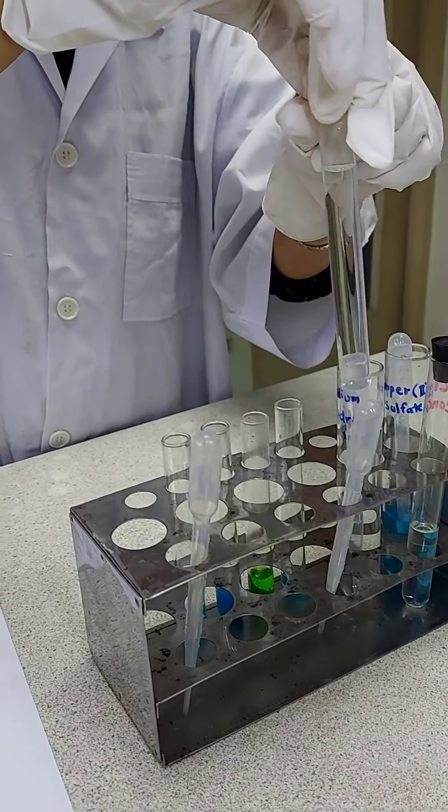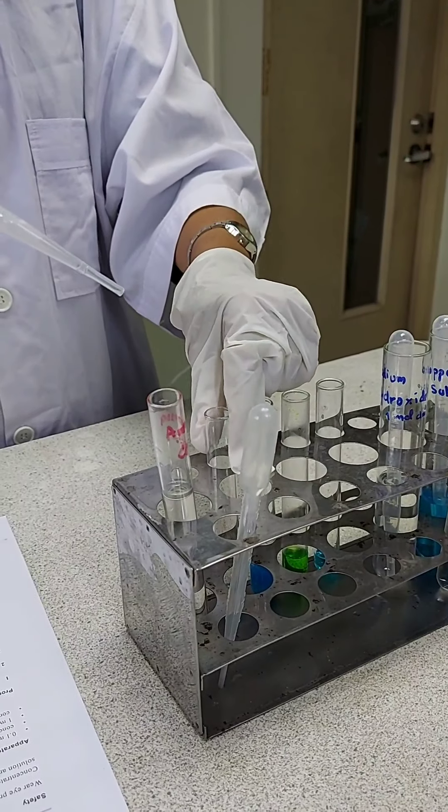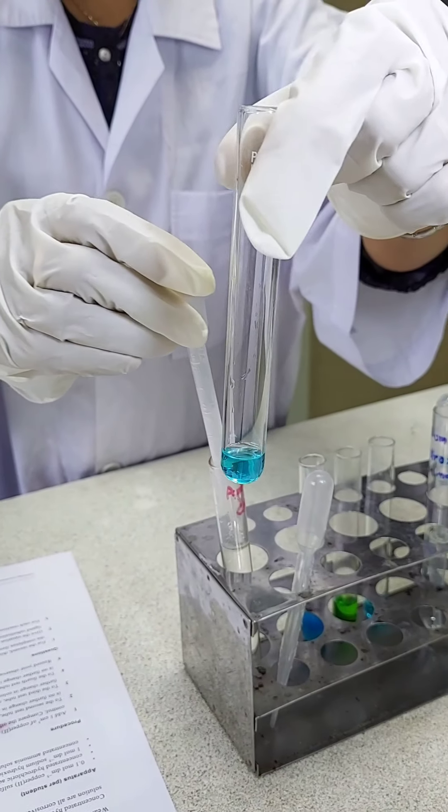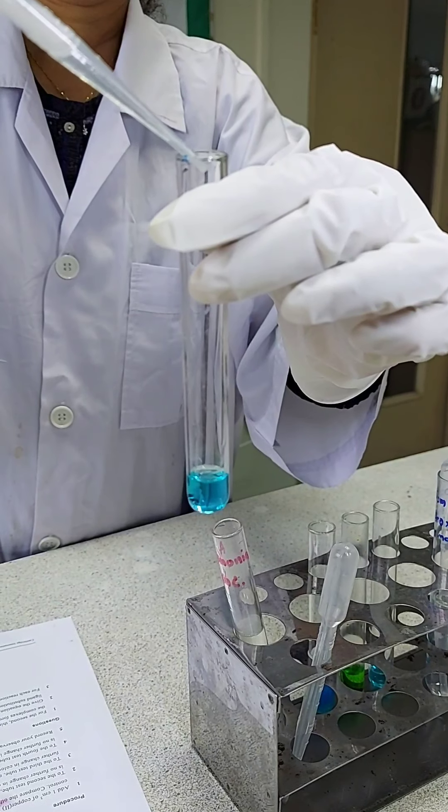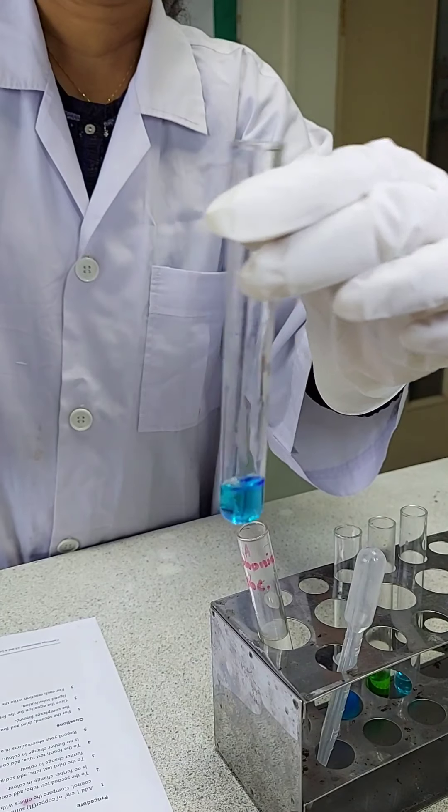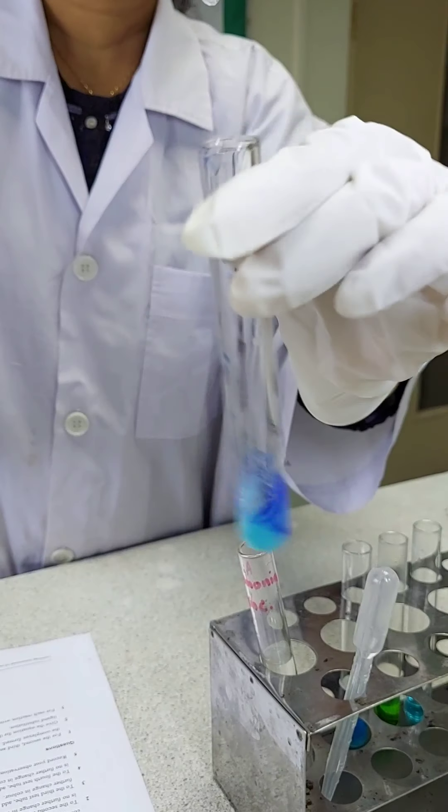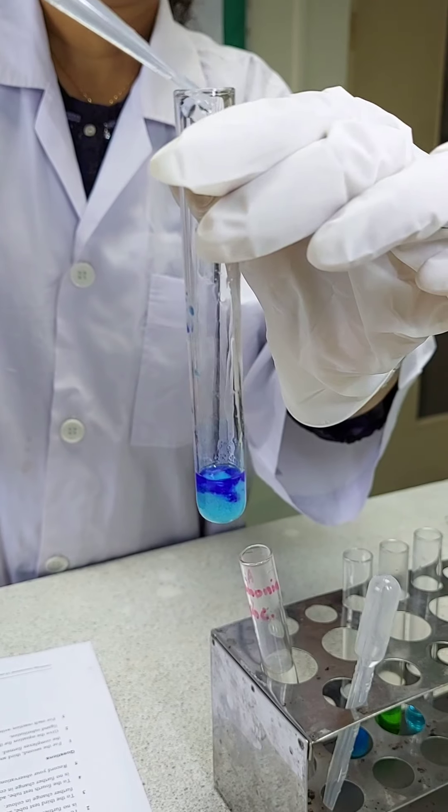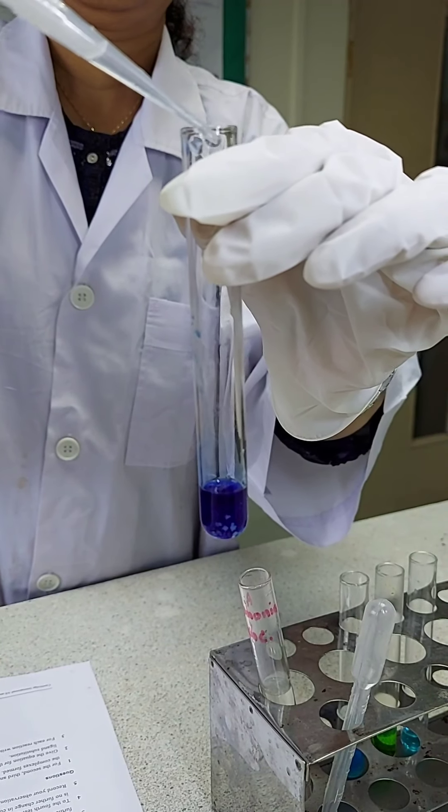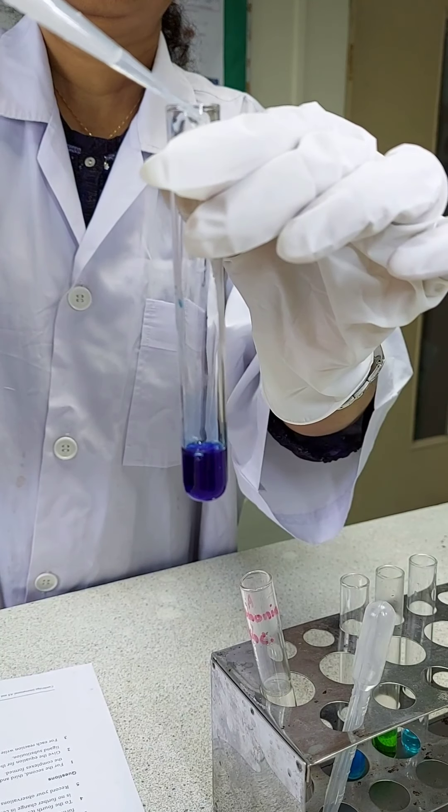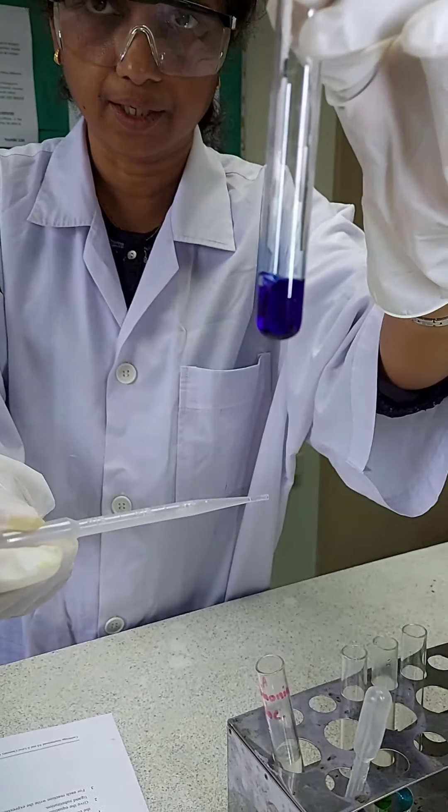And to the last one, I'm adding concentrated ammonia solution. You're getting a clear dark blue solution.